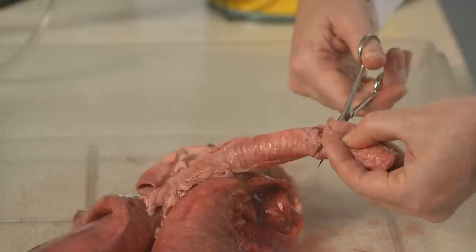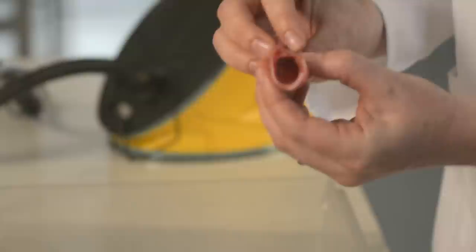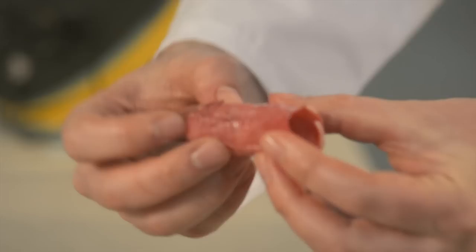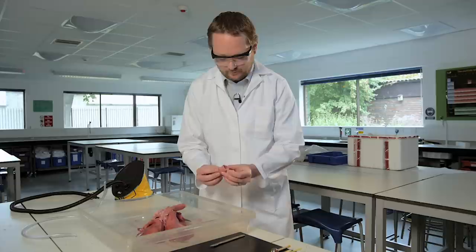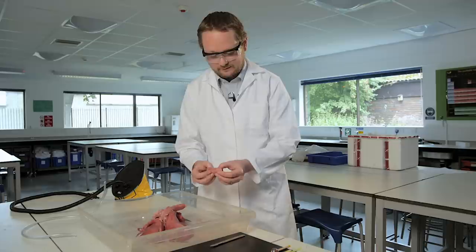So there is always this airway down into the lungs. This is a real three-dimensional object, a tube. And in a diagram, it's just going to be a circular representation. But here we can see that it's actually a tube. And I can stick my finger through it and show that it's hollow. This is something that I would pass around students to get them to have a little feel.